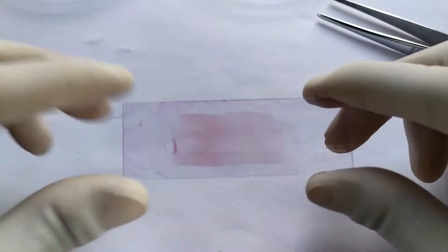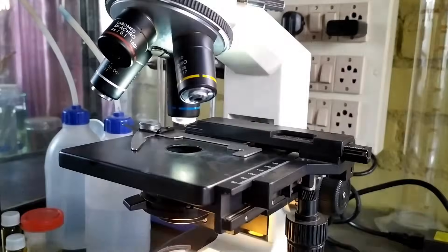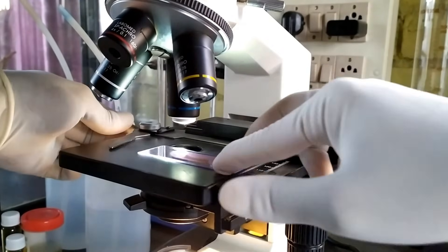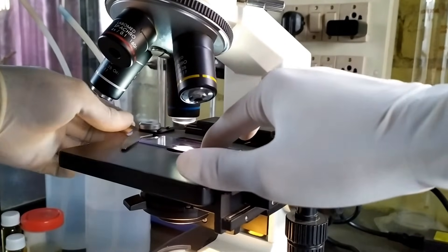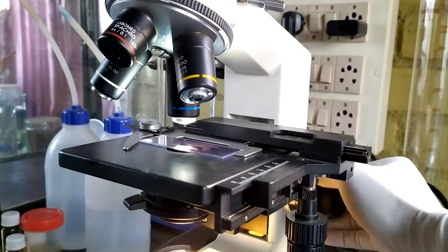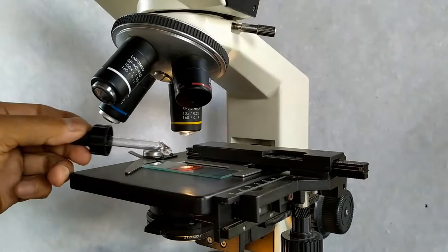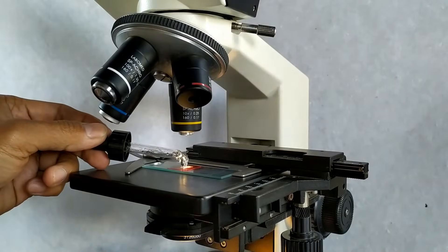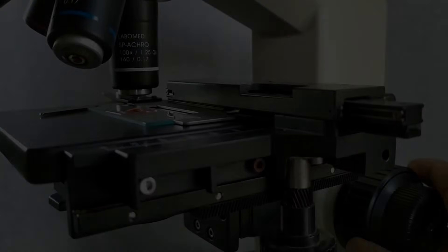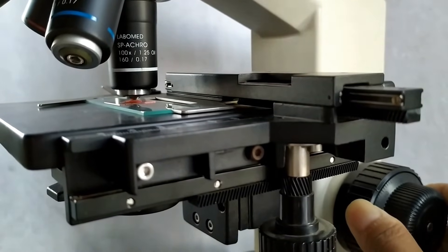Once you have the stained blood smear dried and ready, place the slide on the microscope stage and first observe under low power of the microscope to get an idea of the distribution of the blood cell components on the slide. Now switch to the 100x oil immersion objective of the microscope. Add a drop of immersion oil on the slide surface and gently lower the objective lens until it touches the oil surface.